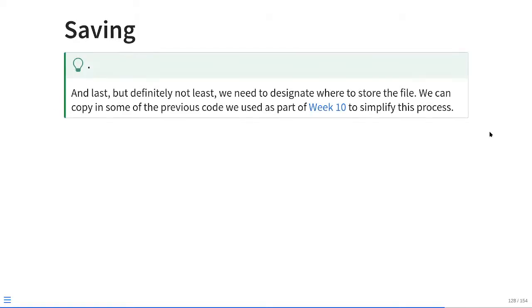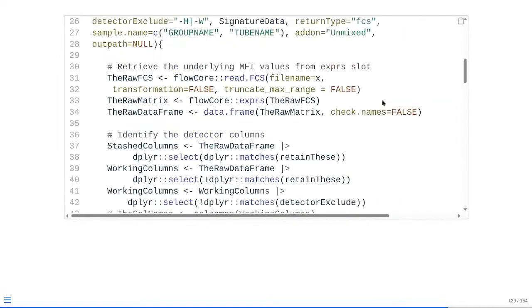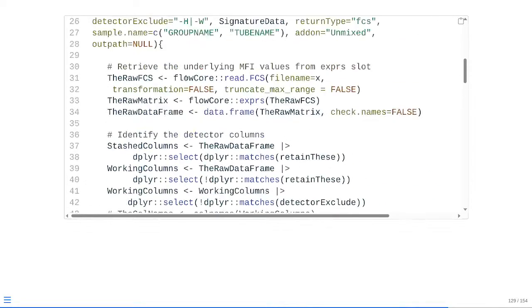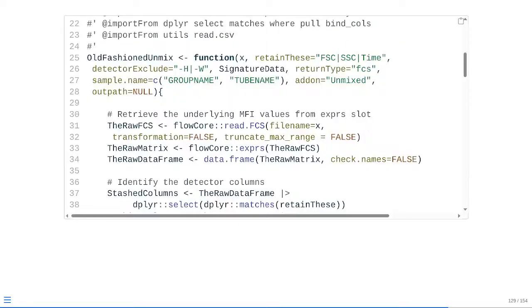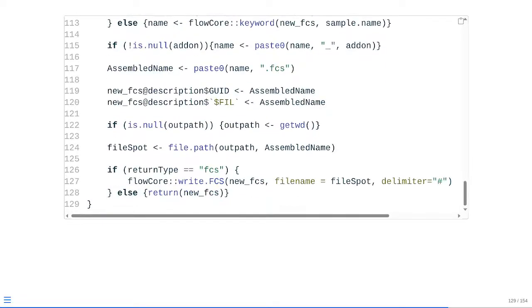And last, but definitely not least, we need to designate where to store the file. We can copy in some of the previous code that we used as part of the week 10 to simplify the process. What this is going to look like is if we copy in, paste that code, we need to add in one new argument, in this case outPath. And as you may remember, outPath is set as a default of null, which basically means if the situation where you have a designated location you want to store it to, you give it a file path, outPath is no longer going to be null, i.e. it's no longer going to be empty, so it will actually carry out that process.